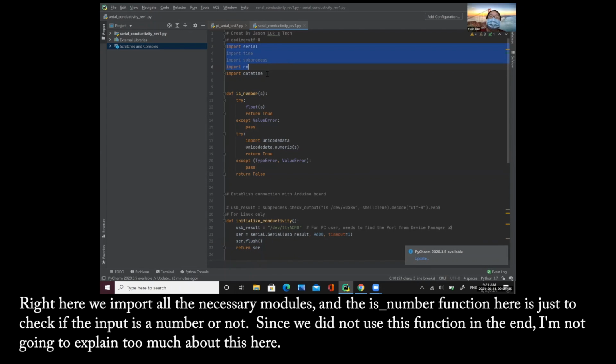Right here, we import all the necessary modules, and the is_number function here is just to check if the input is a number or not. Since we ended up not using this function, I'm not going to explain too much about it here.